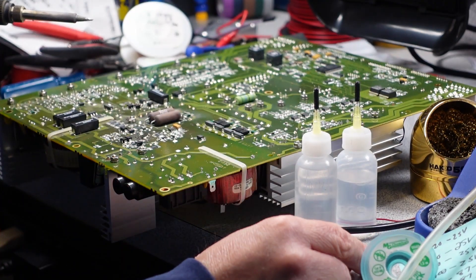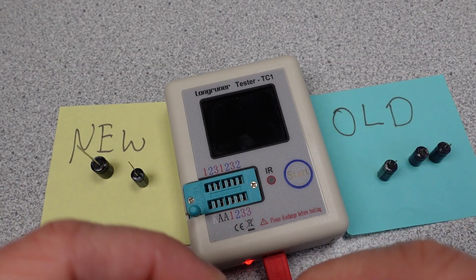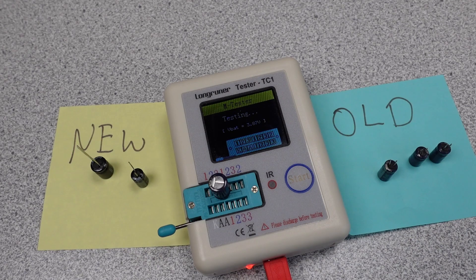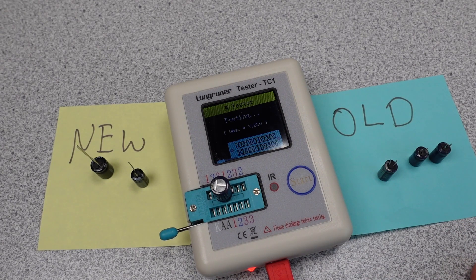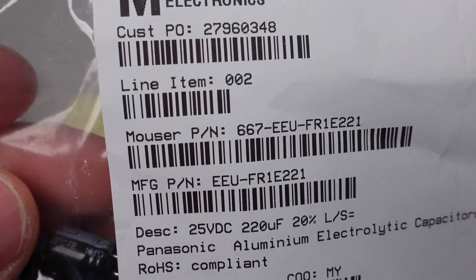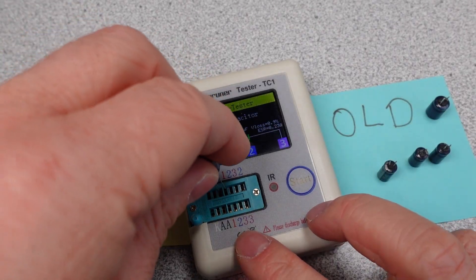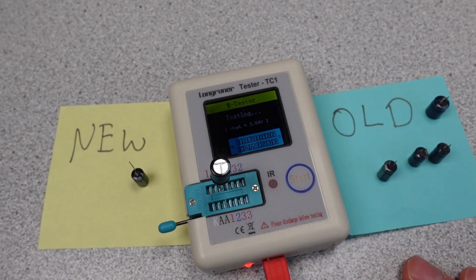As long as the machine hasn't been allowed to run too long in this condition and nothing else is damaged, these are the main issue. The old capacitors need to be removed and checked for performance — they cannot be checked in circuit. Using an inexpensive component tester, we can check not only the capacitor's value but also what we really care about here: equivalent series resistance. The resistance determines how fast a capacitor can deliver its energy. As a capacitor ages, this value may increase, and with all the heat in this area it's no wonder these capacitors have lost capability. One capacitor measured approximately 150 ohms of equivalent series resistance — there is no way this is going to work. The others all measured on the high side. I went ahead and purchased Panasonic replacements and measured values of a few new and old before installing. The new ones all measured very low ESR and met capacitance tolerance easily. These tiny parts only cost a couple dollars but render this whole machine into a brick instead of a complicated piece of lab gear.